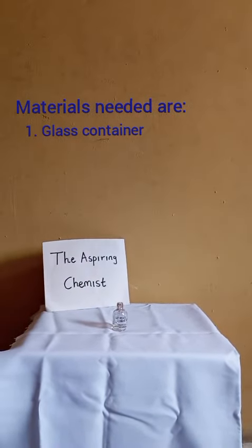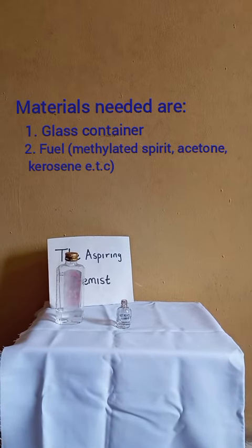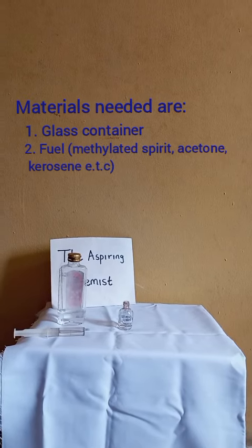Then you need a fuel. You can use acetone, methylated spirit, or kerosene, any one you like. But I'm going to use methylated spirit. Now I'm going to transfer the spirit into the case.